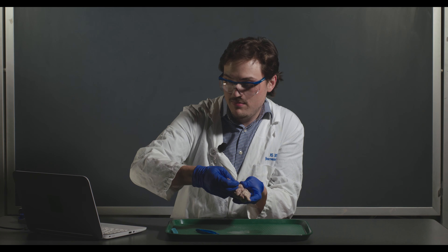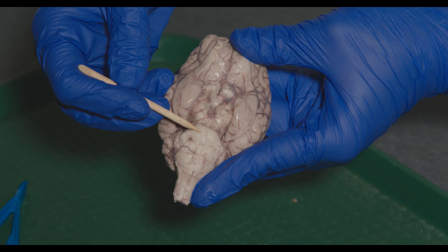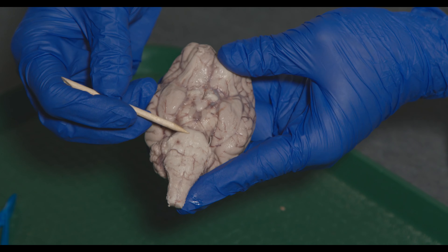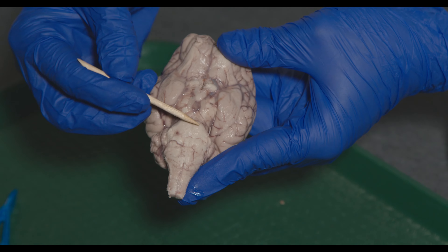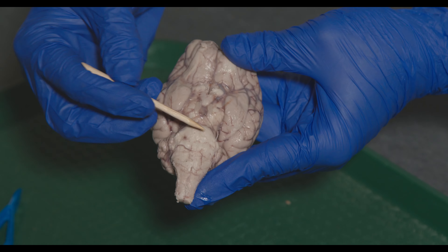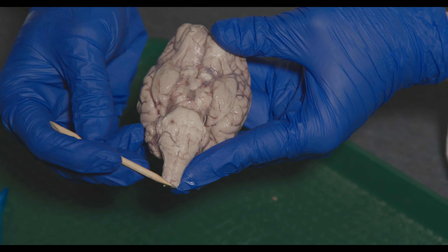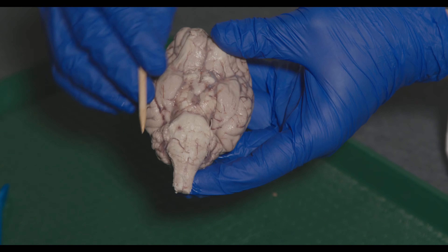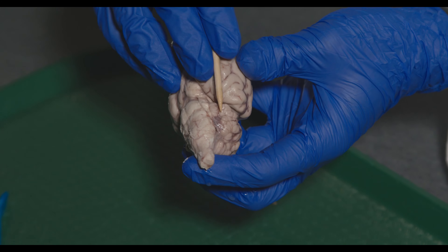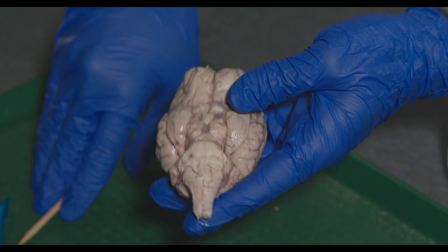From the midbrain, going a little more caudal or inferior, you can see the pons — these bumps right here. Just below the pons is the medulla, which then transitions into the spinal cord. On the other side of the pons, you can see the cerebellum, because the pons relays information to the cerebellum.